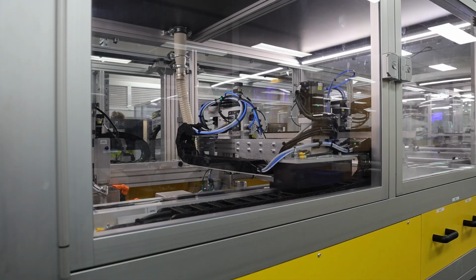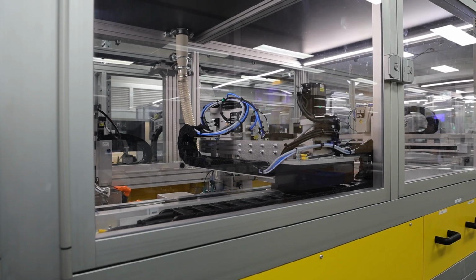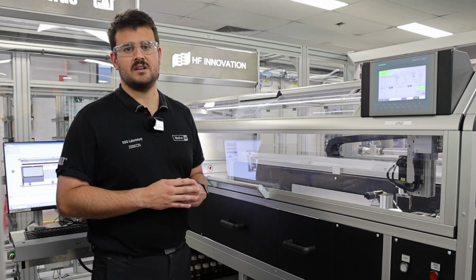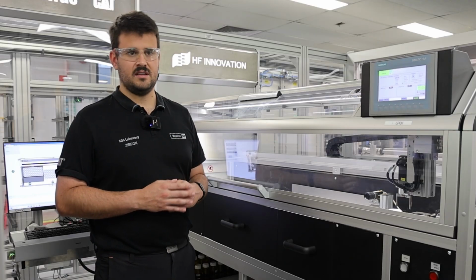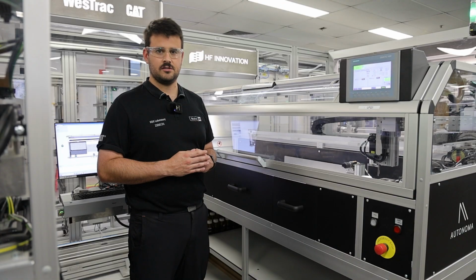Underneath that platform are a variety of different magnetic fields, and as it travels through those magnetic fields, it's detecting how much it interferes and interacts with them. Based on how much it interacts with that magnetic field, it's able to calculate how much ferrous material is inside of your oil sample, and from there, we can make a judgment as to whether there's a high amount of iron particles or a high amount of iron-containing dirt in your sample.